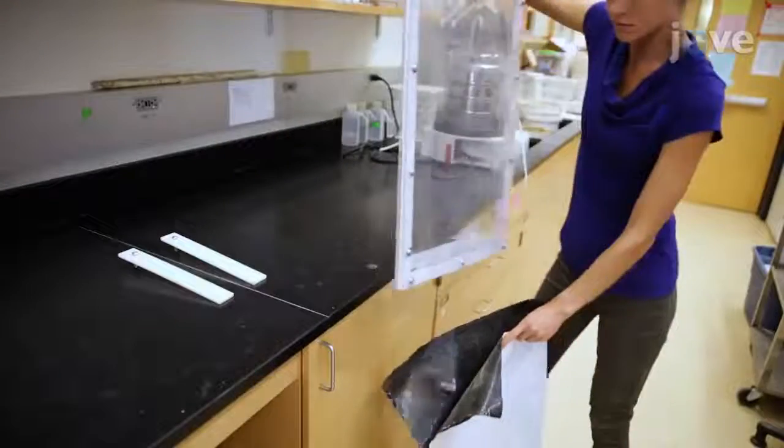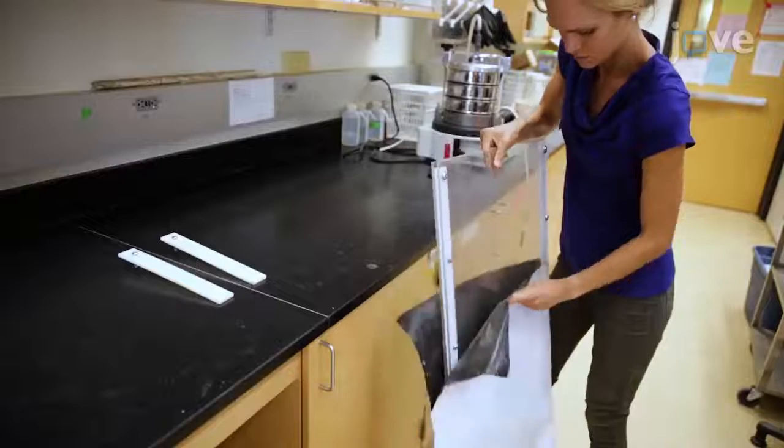For light deprivation and heat reduction, prepare a protective case that can enclose the box.